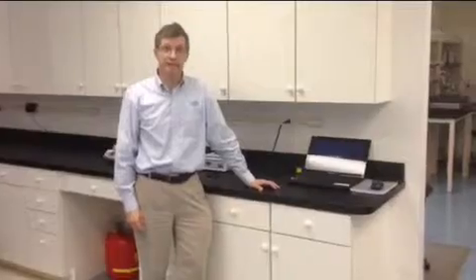So this is our login computer. So when samples arrive, we take note of their condition. We record that, the number of samples, where we store them. We also record the destruction or return date, and that of course is dependent upon each client who we deal with.